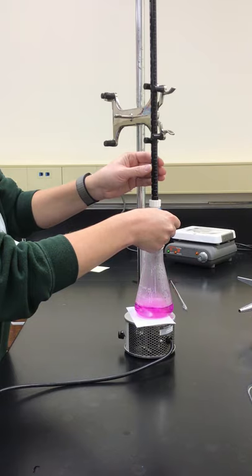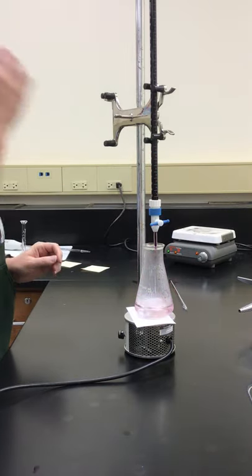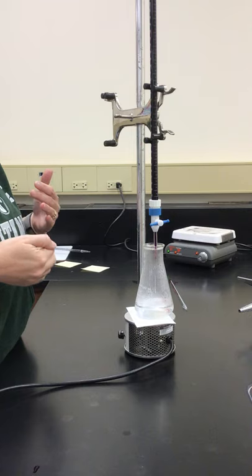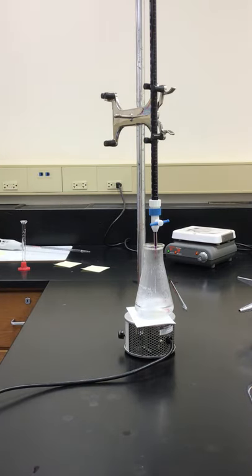We want that light pink color to stay. You can see how it turned purple there for a second, but then it went back to clear.